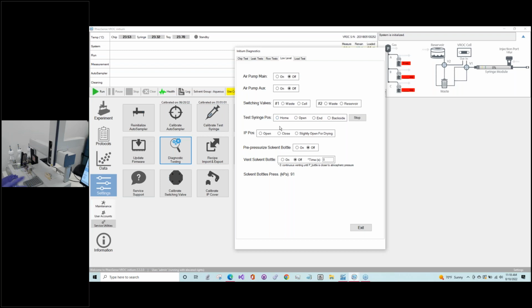The other thing here that I want to point out is the test syringe position, or the injection port position. So if you are failing the one leak test that's looking for leakage at the injection port cover, what you can do is open and close it from here. You'll also need to do this, which we'll talk about more in a moment, to change out your O-ring. But sometimes it just doesn't seat properly at some point, and opening and closing it a couple times will reestablish that positioning. And so that can help oftentimes when you're trying to deal with identifying the leak failure there. So that is the diagnostics.